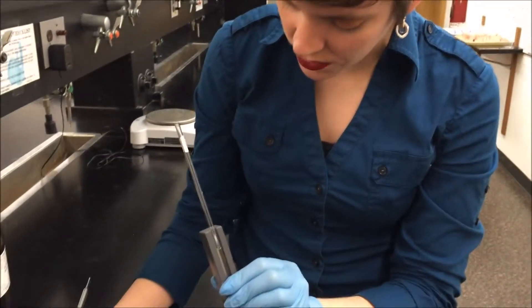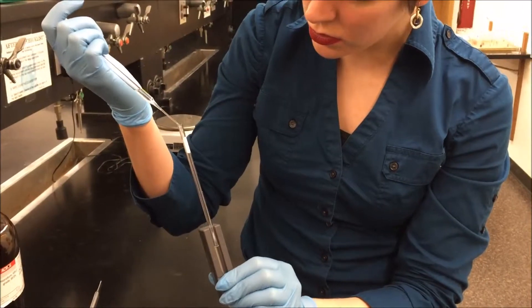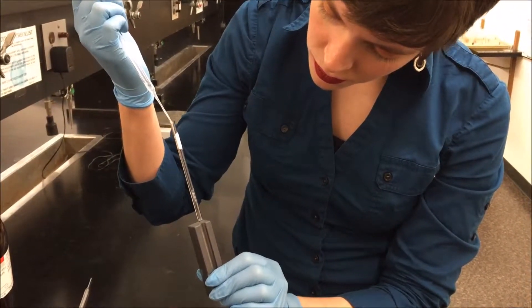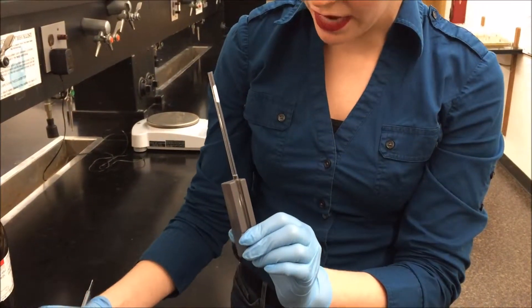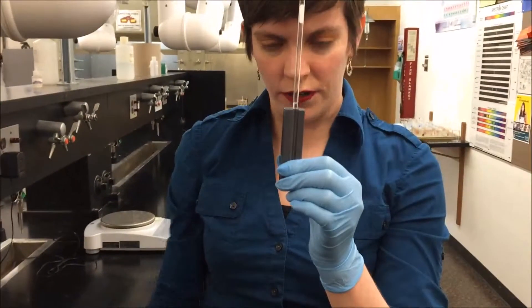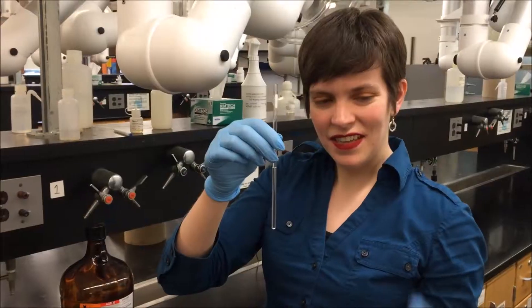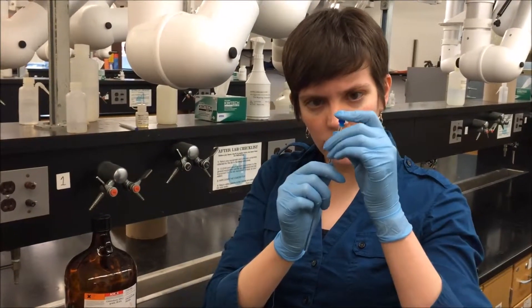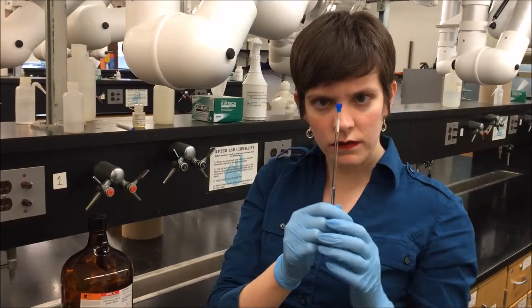I'm not there yet, so I'm just going to add a little bit more solvent. A little over the top — the exact amount over isn't super critical. Then I'm going to put a little cap on it, which just slides over nice and gentle. Make sure it's on straight.